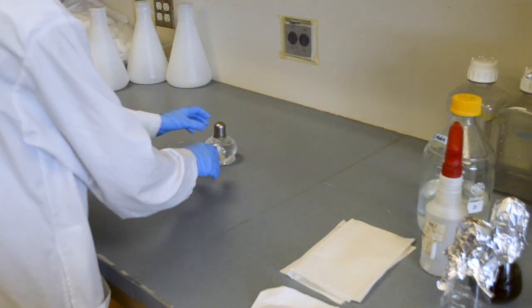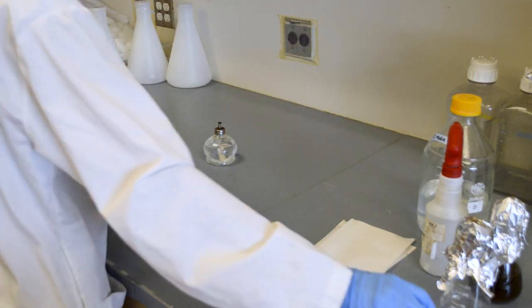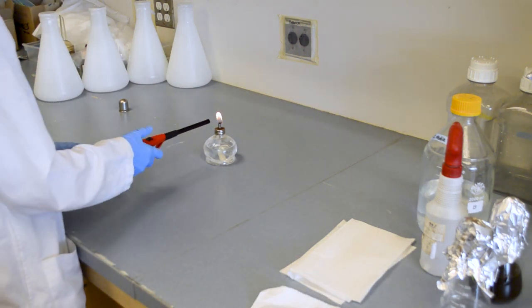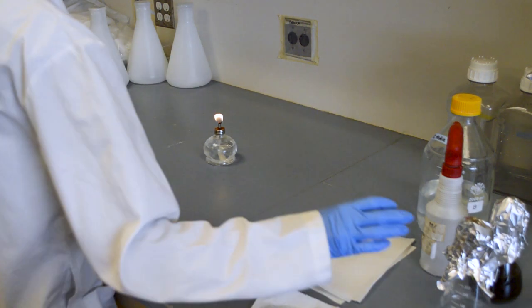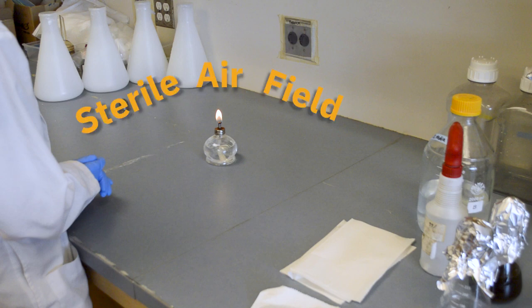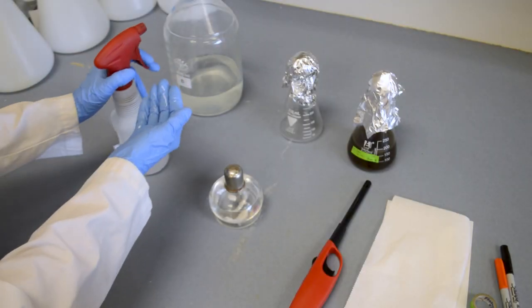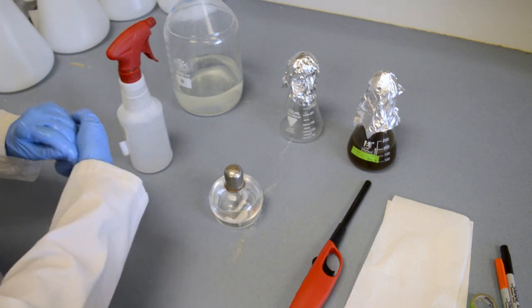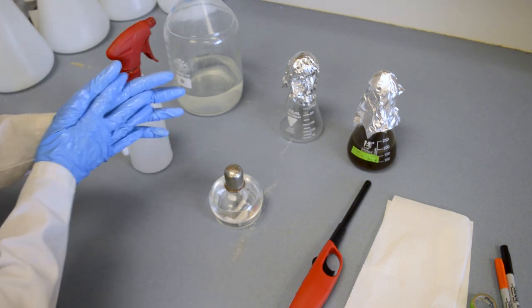But first be sure you keep any fire sources away from your alcohol and make sure to wait until all of the alcohol has evaporated prior to putting hands near an open flame. The flame creates a sterile air field which is why we transfer around it. Remember to re-sterilize your hands, gloved or not, with alcohol after touching any non-sterile surface before proceeding.